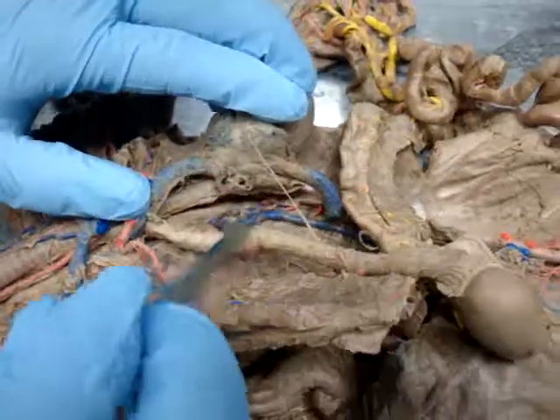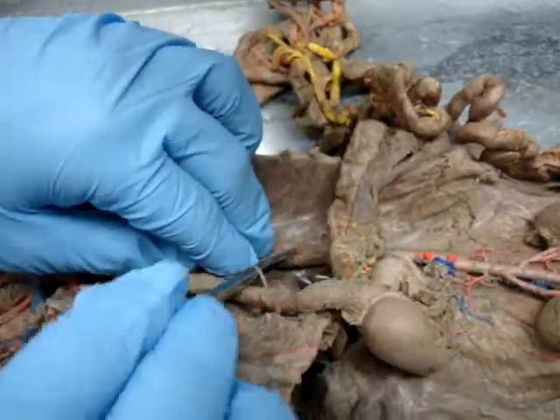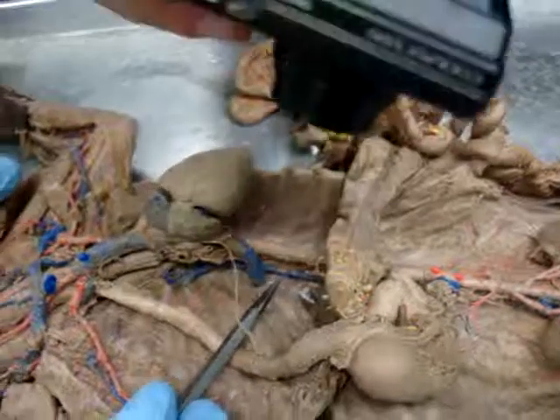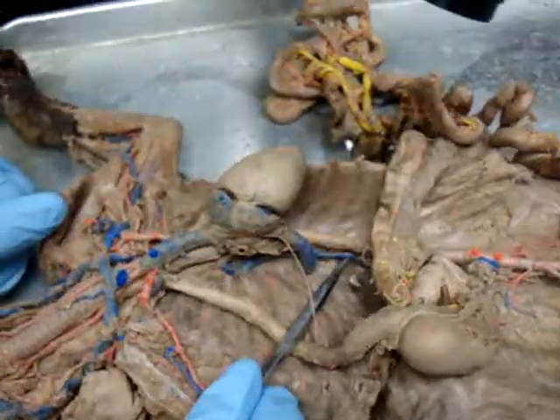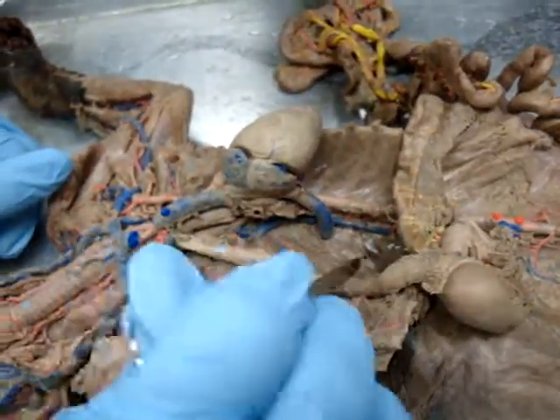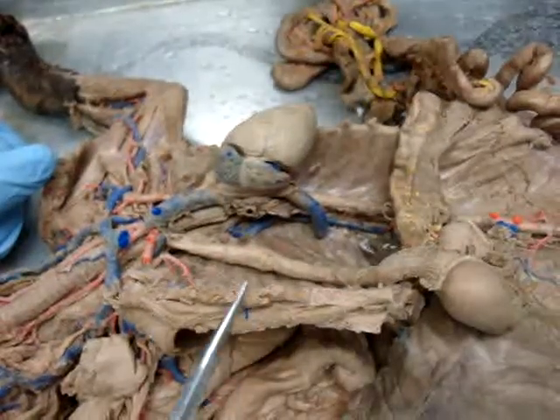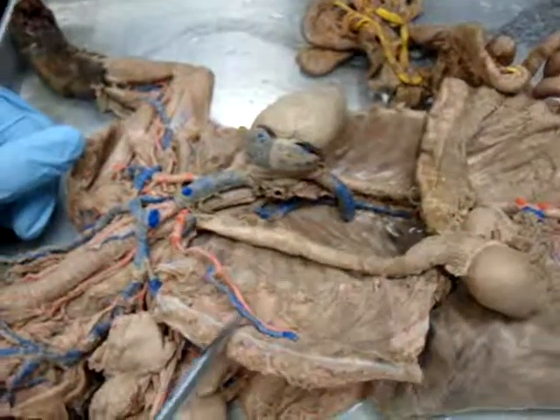we'll roll that way real quick. See this vein running, you can see the entire chest cavity. There's no vein on the left there, but there is a vein on the right here. This is an asymmetric vein. It's called the azygos, and azygos means asymmetrical. So there's your azygos vein. It's going to drain the right intercostal veins and bring it back into there. The left intercostal veins just have to go to the internal thoracic vein. So, and there's your internal thoracic vein on this side as well.